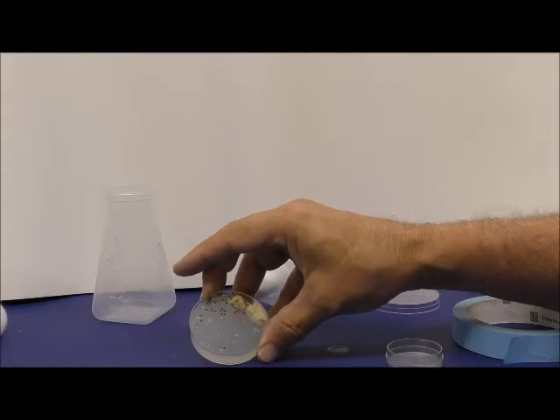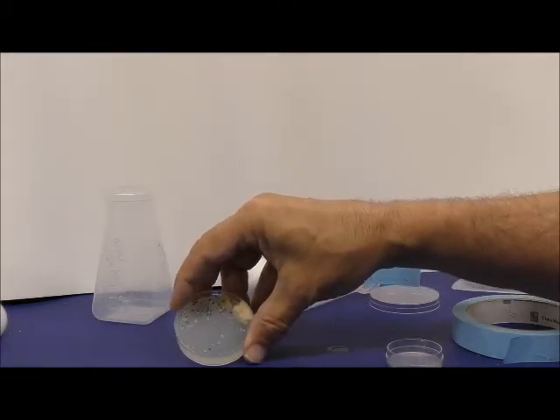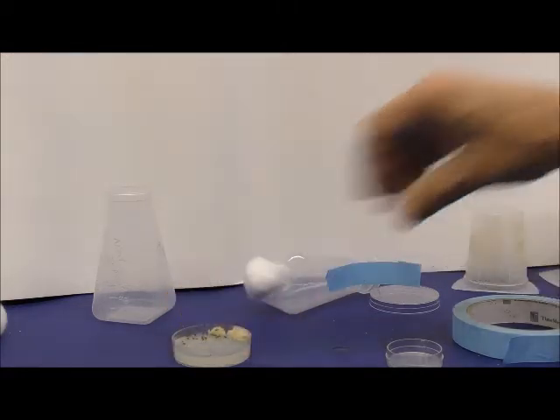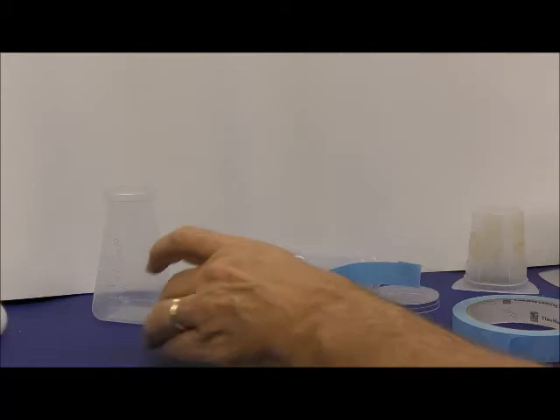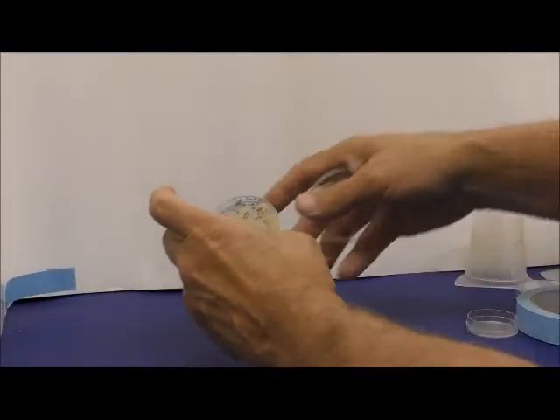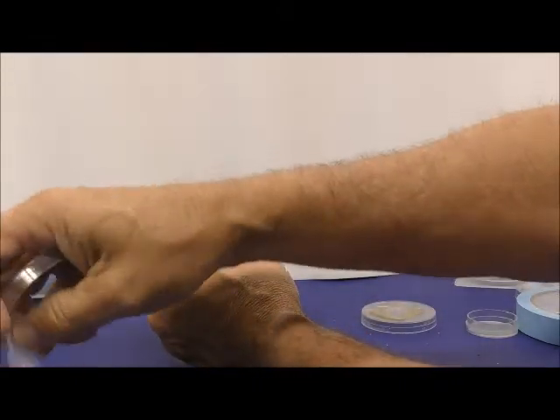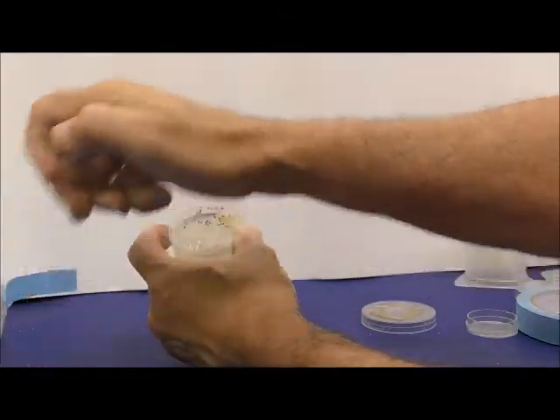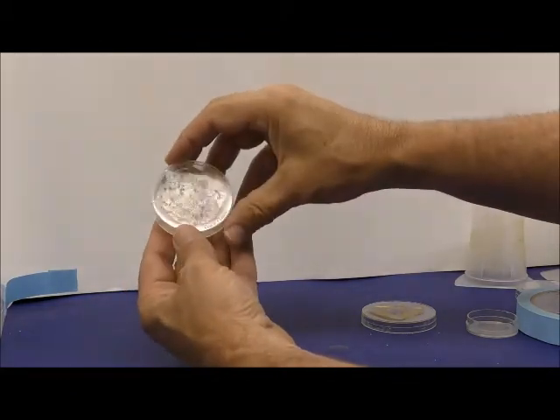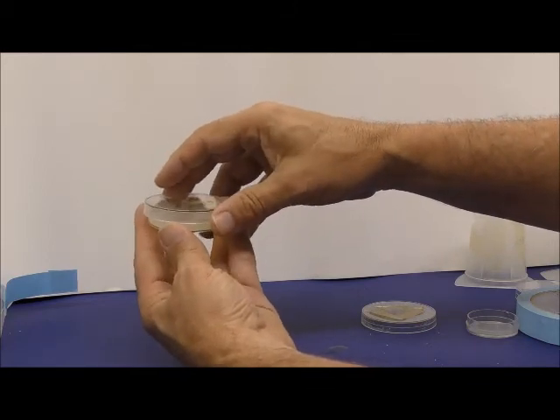If you want to wait and get seconds, then 2 days, and you'll have second instars. So that's another approach. To collect the eggs and not allow them to dry out or die of CO2, if you just put the lid back on, and you put that on like that, even though there's a tiny gap, it tends to kill the flies, the larvae, the embryos, because the CO2 builds up.